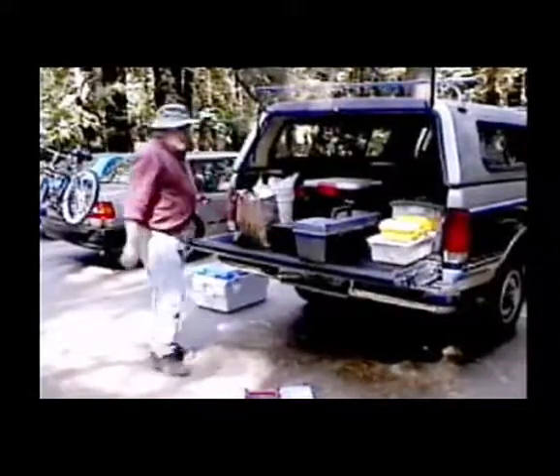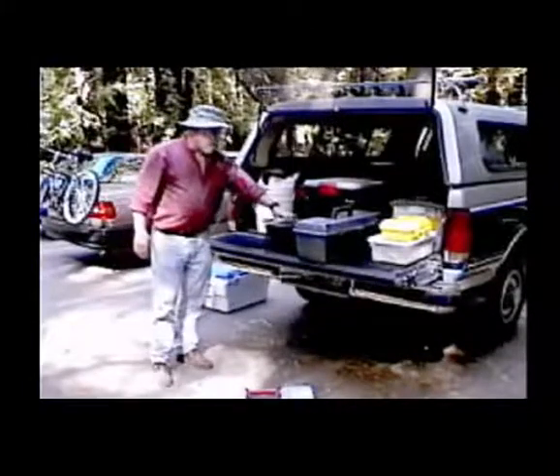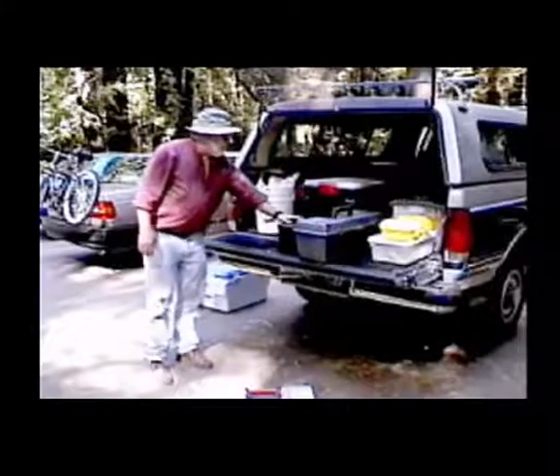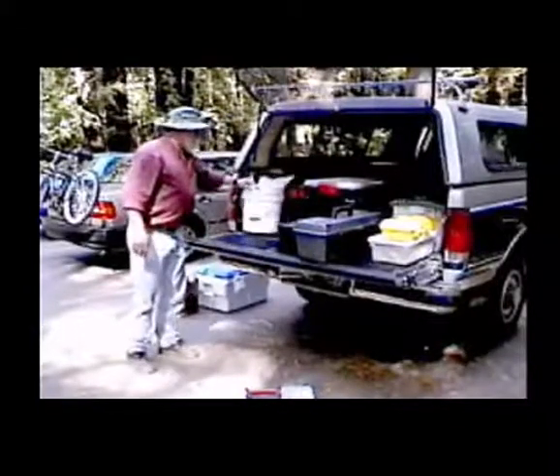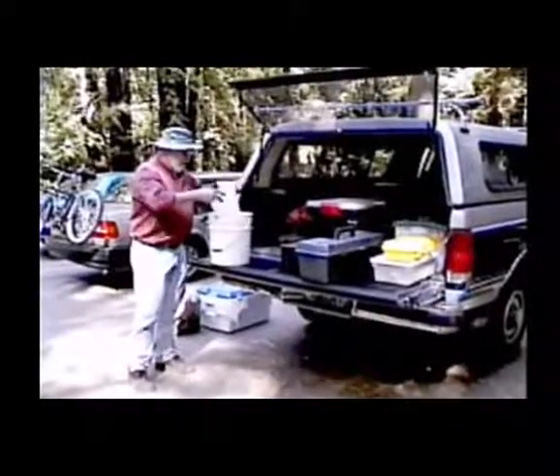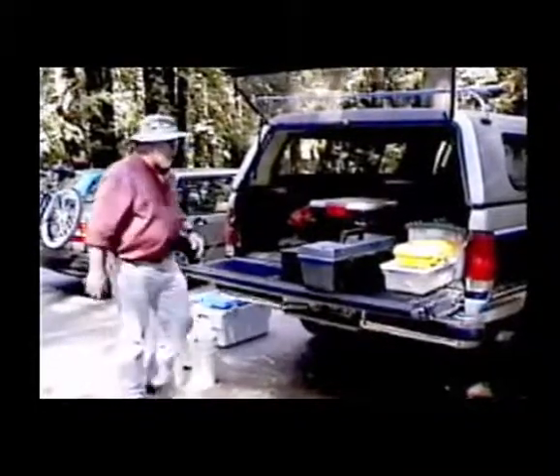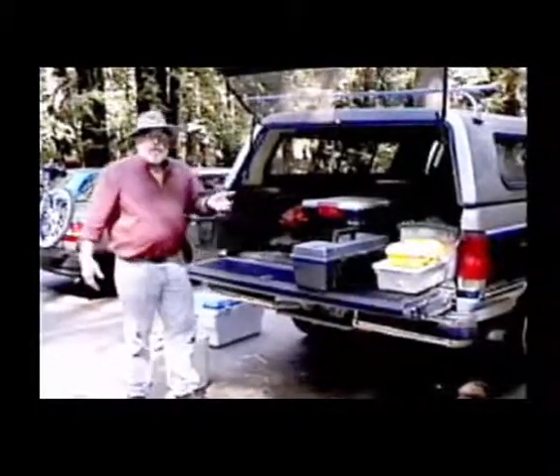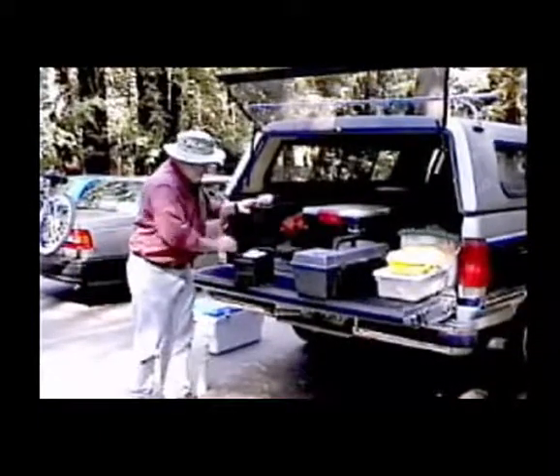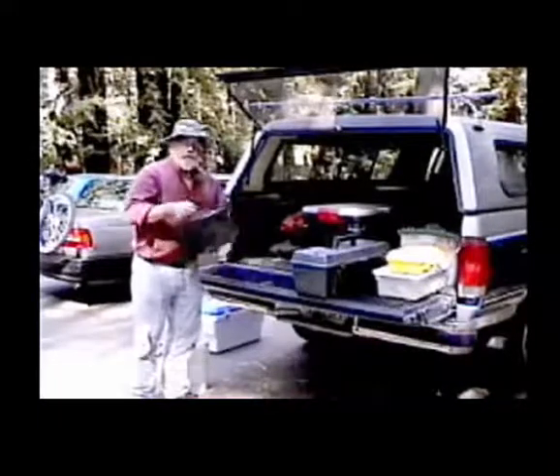The equipment should be put in containers that are at minimum crush proof and water resistant, if not waterproof. So we have buckets. This is a standard 5-gallon bucket, very handy for carrying bulky items, bottles, things like that. It has a handle on it. You can carry it around, very, very easy to carry. Ammunition boxes, extremely cheap, watertight, crush proof, excellent for small items.